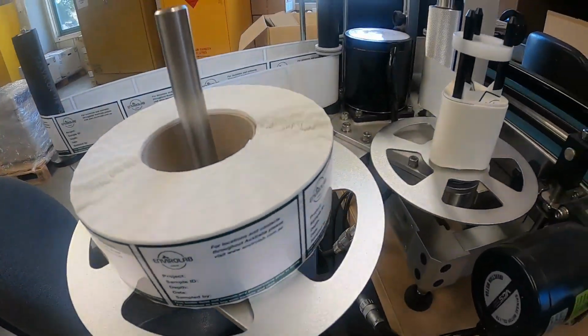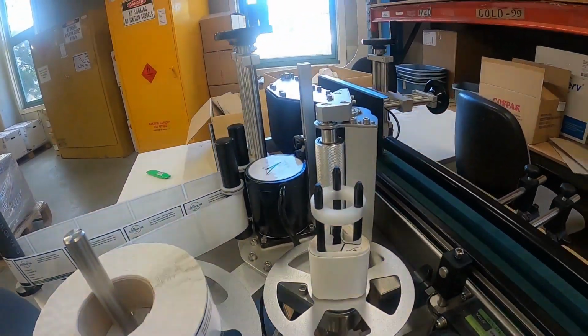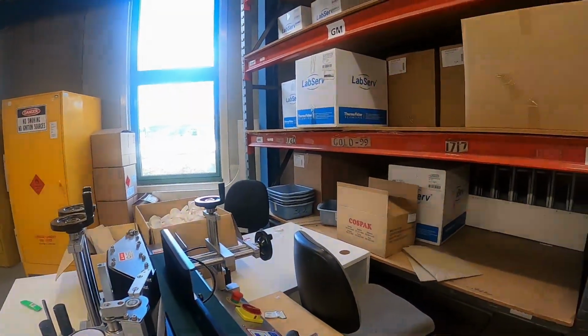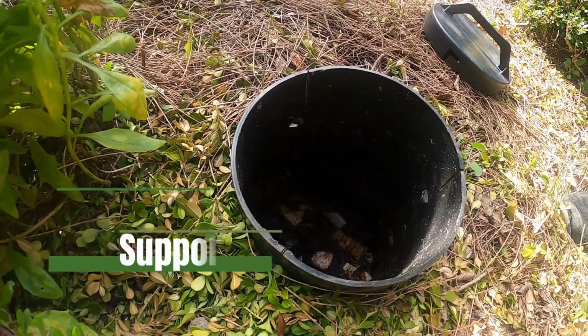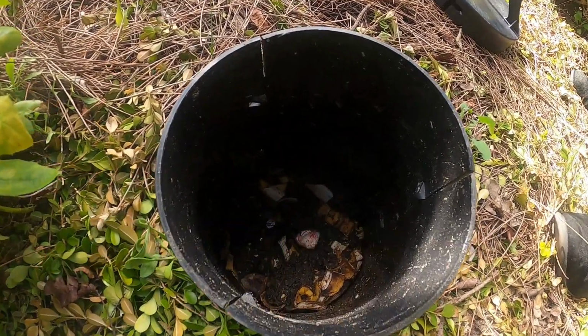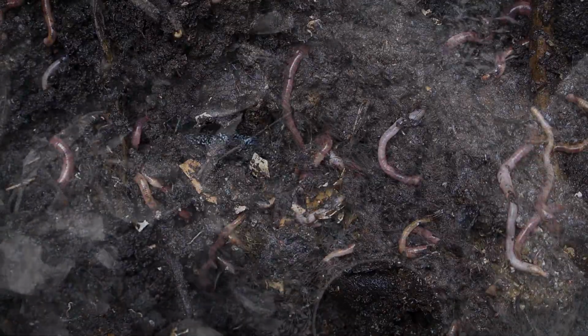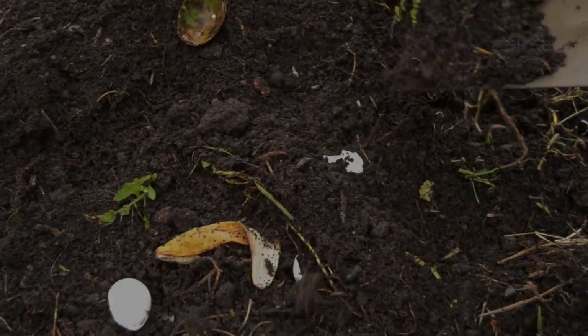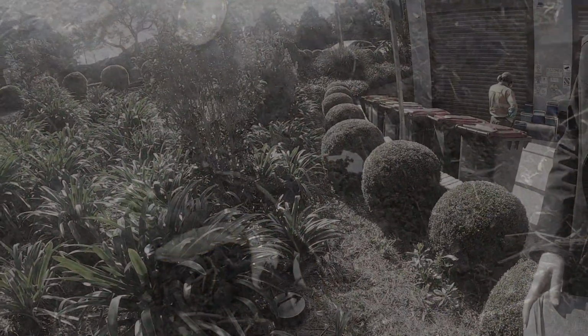We've invested in an automated soil jar labelling machine. It makes life easier as all jars leaving the lab have to have our label on them. And something for the environmentalists out there, Envirolab actually has 4 worm farms, and we're currently composting around 250 kilograms of staff kitchen waste per year.